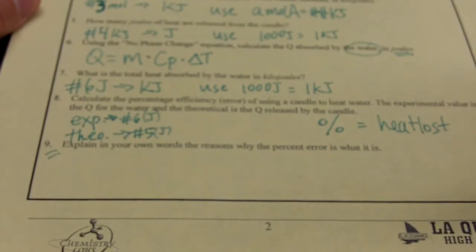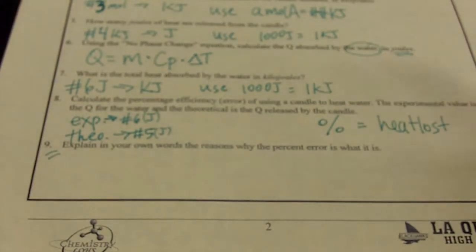About a minute and a half left on heating. Continue to watch or skip forward if you so desire.